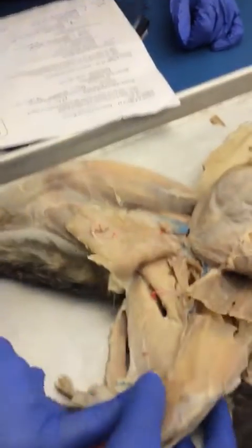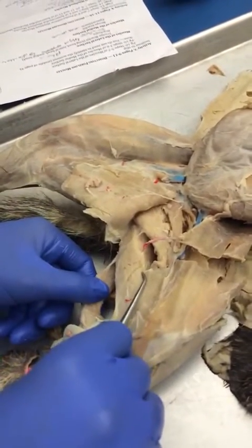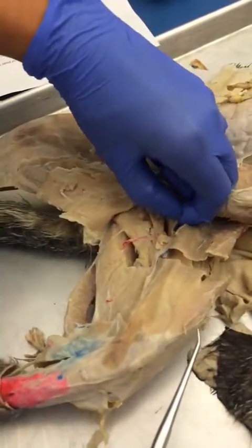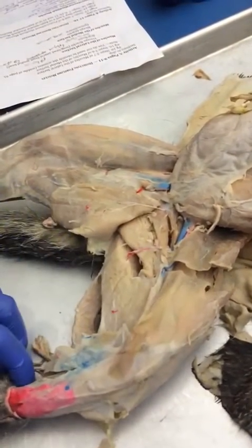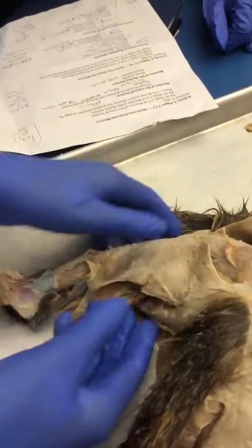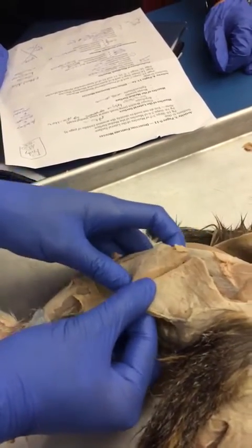Okay. And then above this semitendinosus, you have semimembranosus, and then you have your adductor femoris, and then you have adductor longus. The adductor longus is this thin band, right? And the femoris is the other one. And in the back, the last muscle, this big one that I've been finding people have a hard time remembering, is biceps femoris.